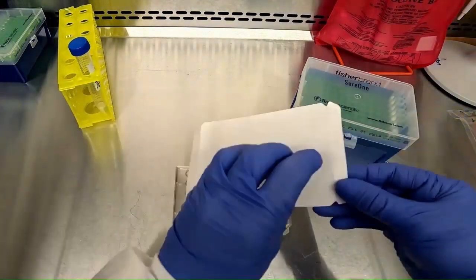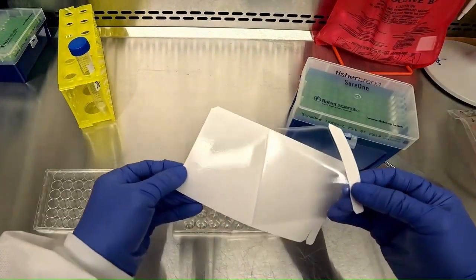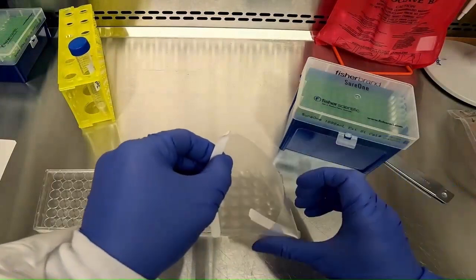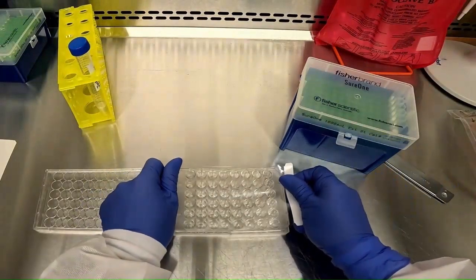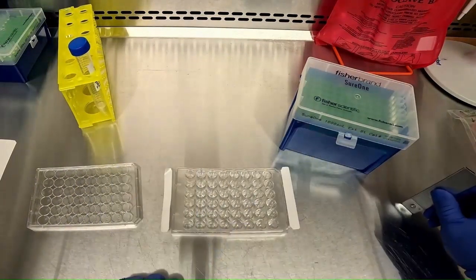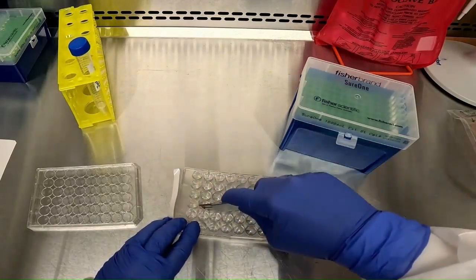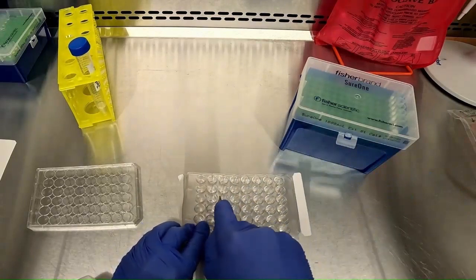Because we're only working with 8 flow cells, we're going to seal the rest of the plate with the plate sealer that comes included with the plate. This will prevent air from entering the microfluidic channels of the other flow cells that we're not going to use in this experiment. And this will also maintain sterile conditions in the plate. To do this, we're just going to use a razor blade to cut out the plate sealer that is on top of the flow cells that we're going to work with today.